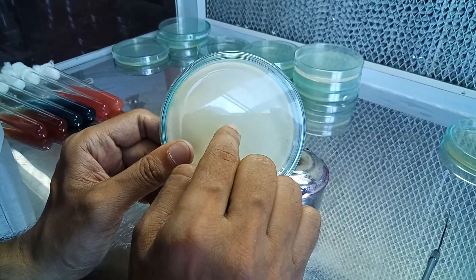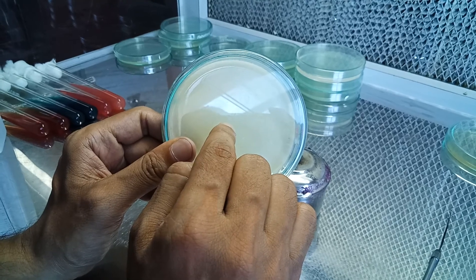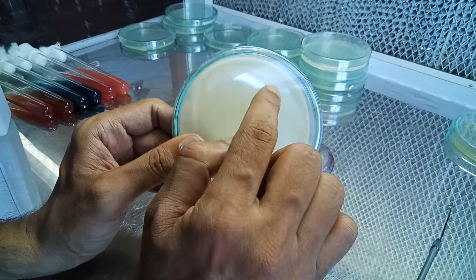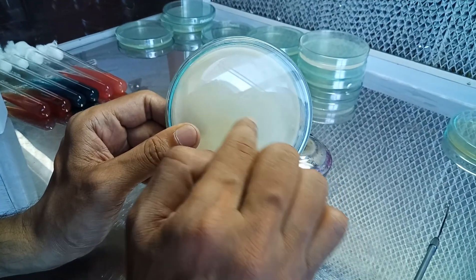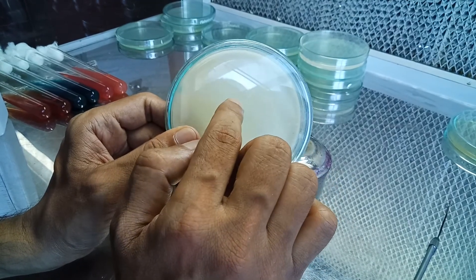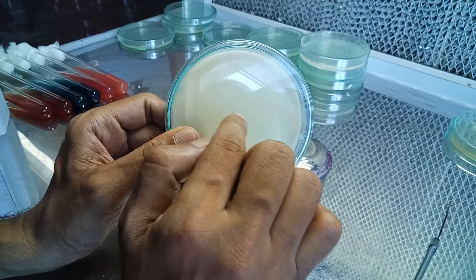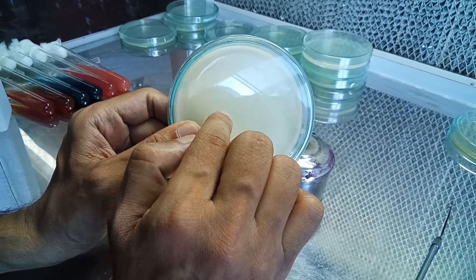If we see a zone of clearance around the bacterial colonies, that indicates the test specimen is positive for casein hydrolysis — it can break down casein. If there is bacterial growth but no zone of clearance, that indicates the bacteria is not capable of hydrolyzing casein and cannot produce the caseinase or protease enzyme.